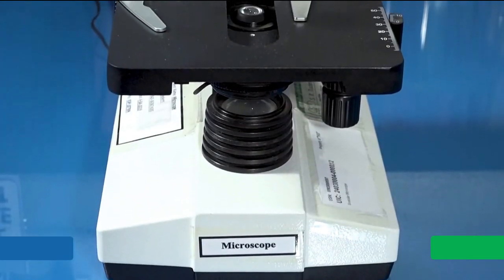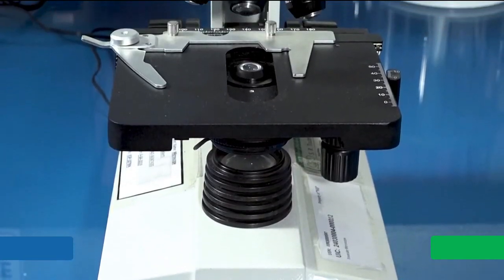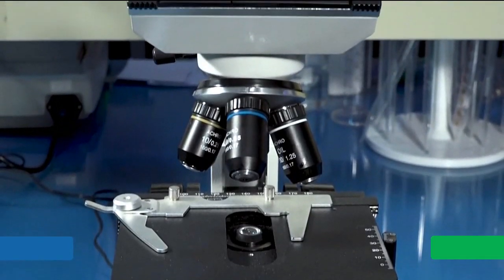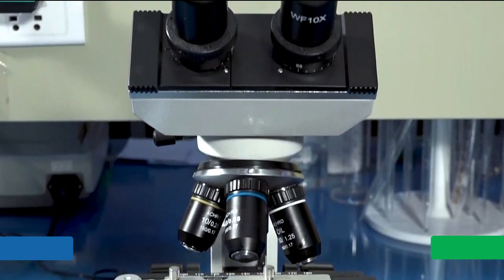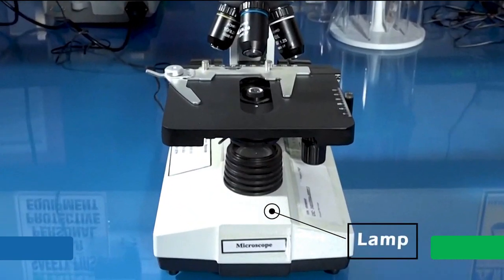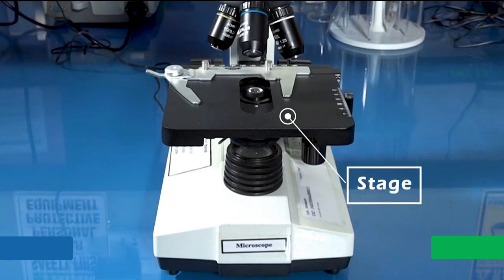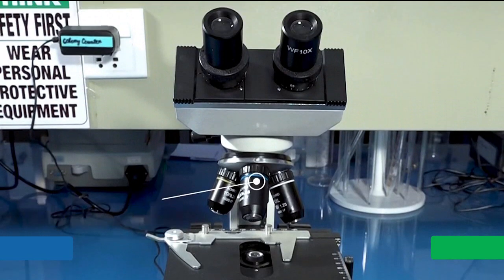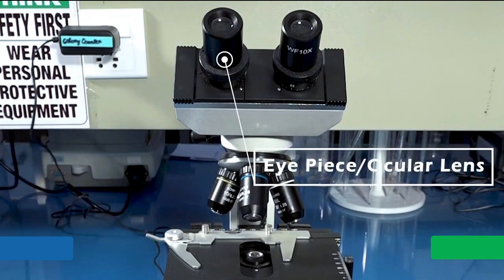Microscope is an instrument used to visualize very small objects. This is a compound microscope. Its major parts consist of lamp, stage, objective lens, eyepiece or ocular lens.